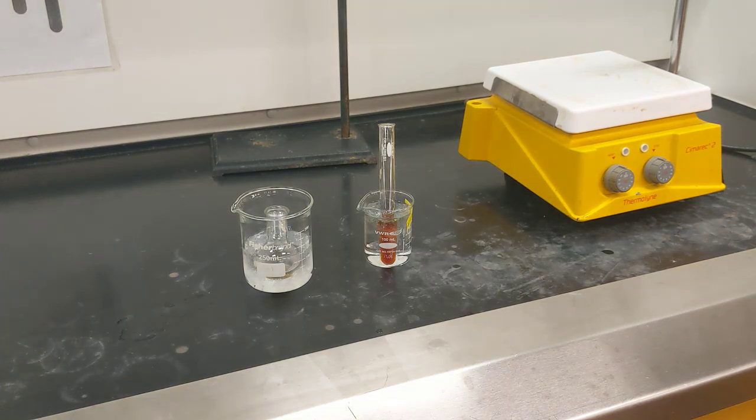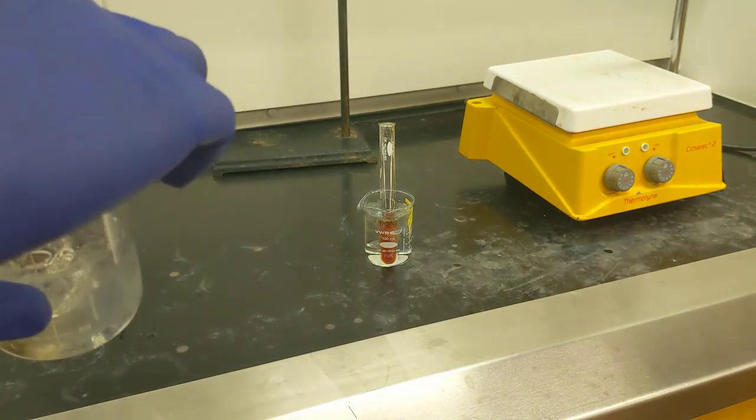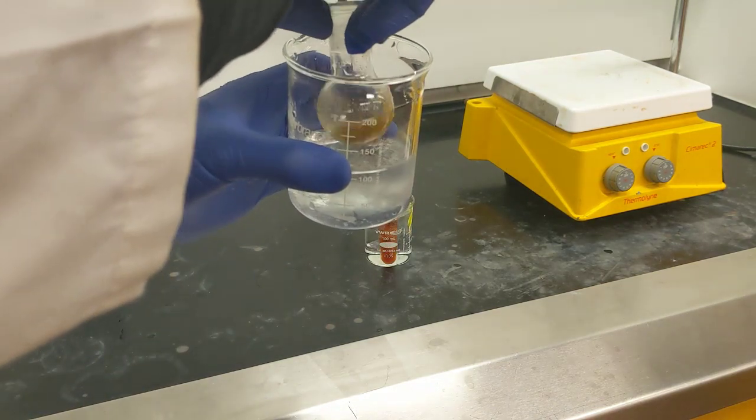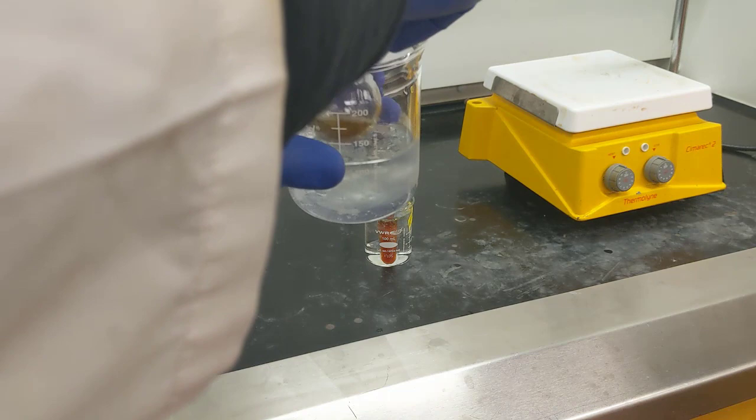Alright, now that I've got all of my reagents in there, I'm going to grab a stir bar and put it on my stir plate to ensure that everything is mixed evenly. Now that I've got my stir bar, I'll toss that in. I'll give it a quick swirl by hand, and then I'm going to put it on the stir plate. It's okay if it doesn't stand up perfectly.